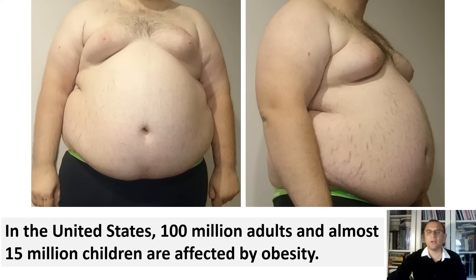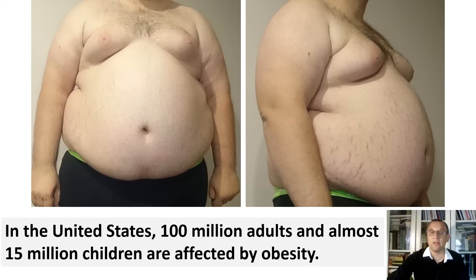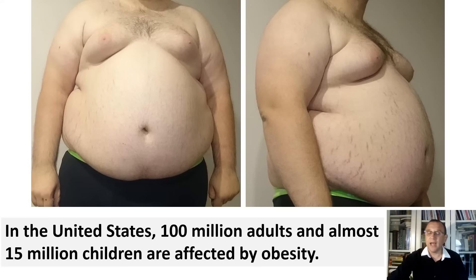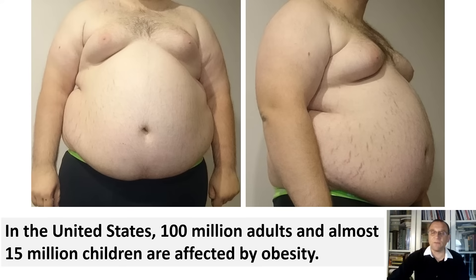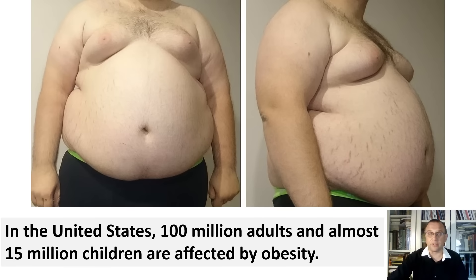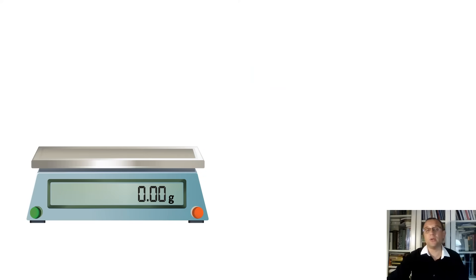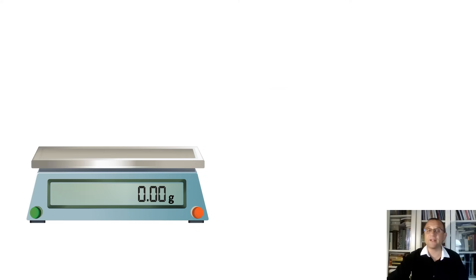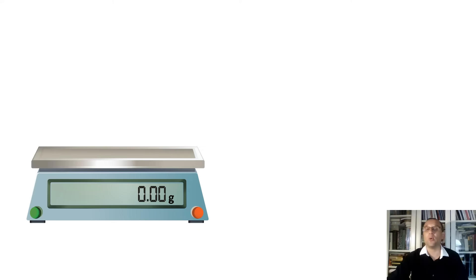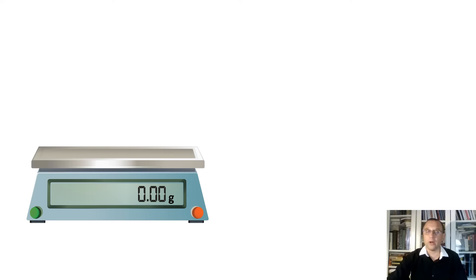According to the Centers for Disease Control and Prevention, as of 2003, obesity in the United States affects 100 million adults and almost 15 million children. But let's go back to our measurements. During the first day in the biology lab, students usually have an exercise measuring weight and volume using all kinds of scales. We will measure mass and volume of water today.